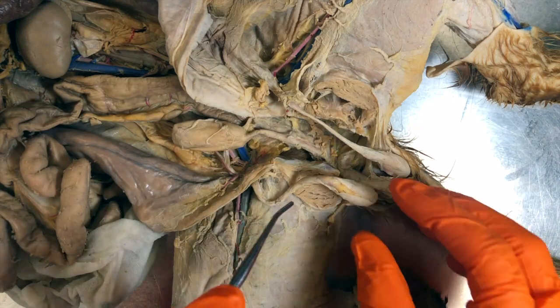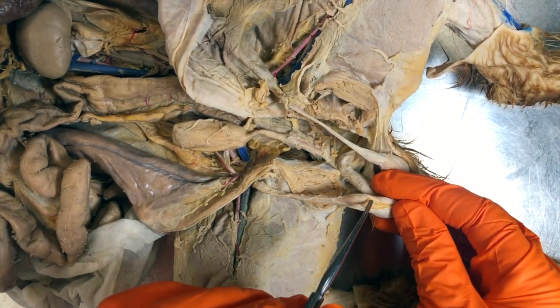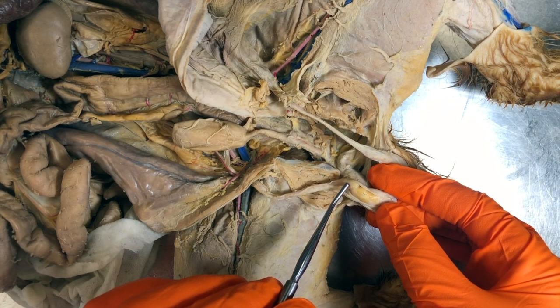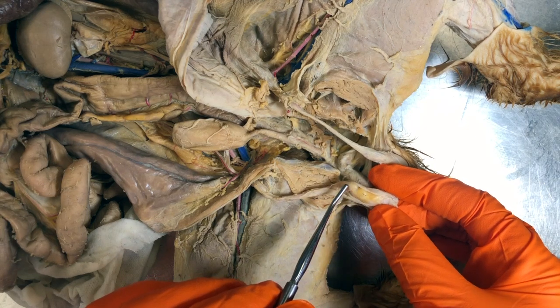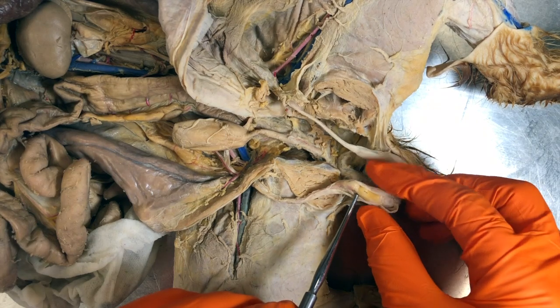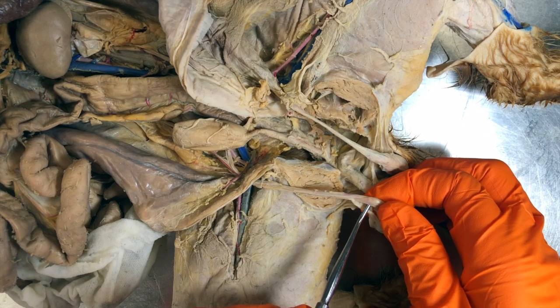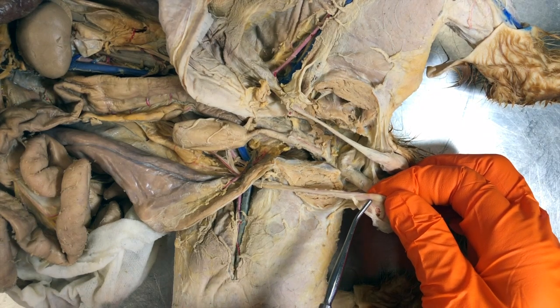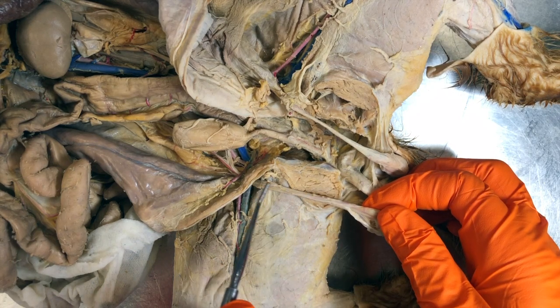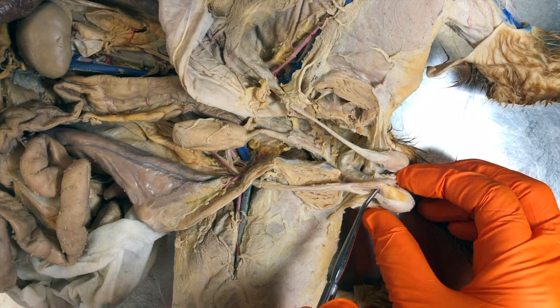This part right here that connects to the testis is the epididymis. The epididymis covers the cephalic end of the testis and it leads into a passageway. There is a passageway that runs through this cord right here called the vas deferens, or the ductus deferens.